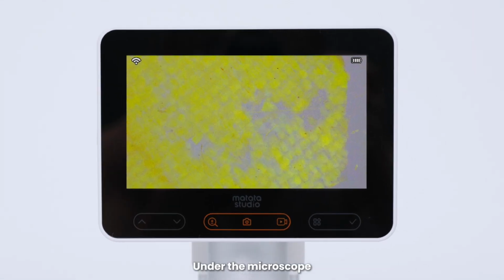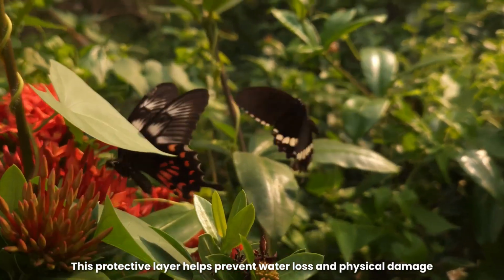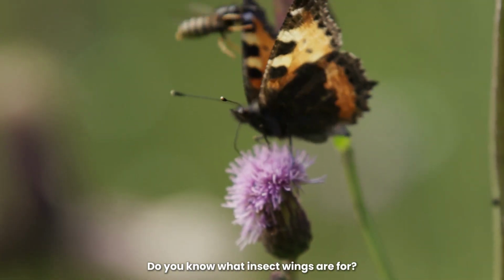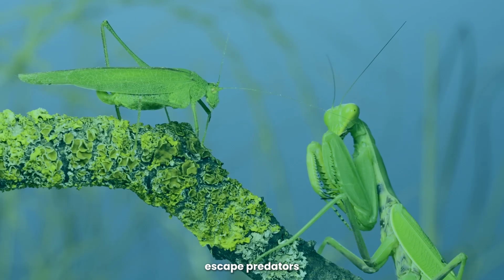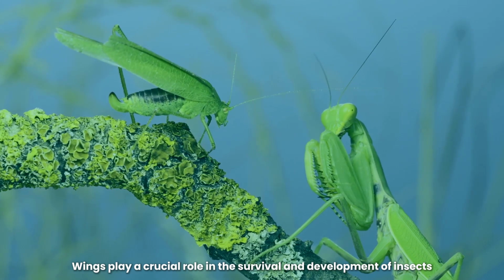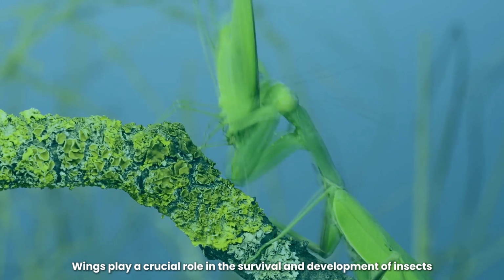Under the microscope, you can see the yellow pigments on the scales and a transparent protective layer on the wing surface. This protective layer helps prevent water loss and physical damage. Do you know what insect wings are for? They help insects hunt, escape predators, find better living environments, and attract mates. Wings play a crucial role in the survival and development of insects.